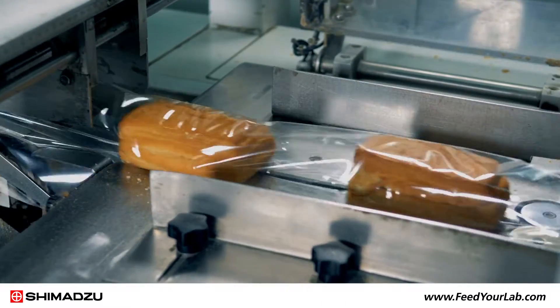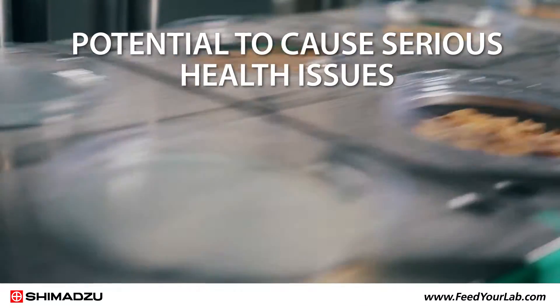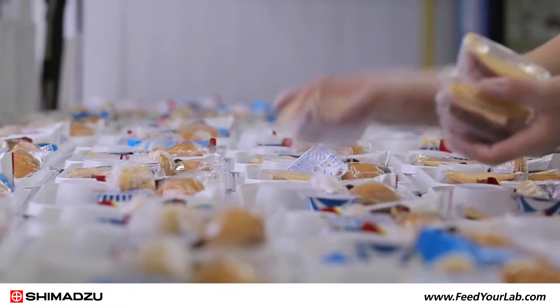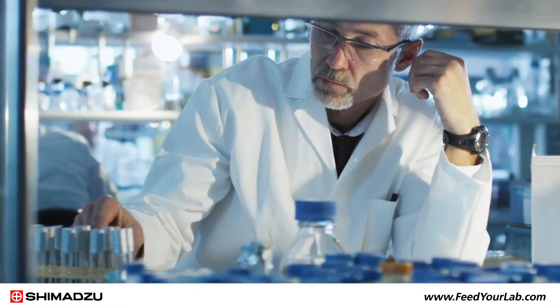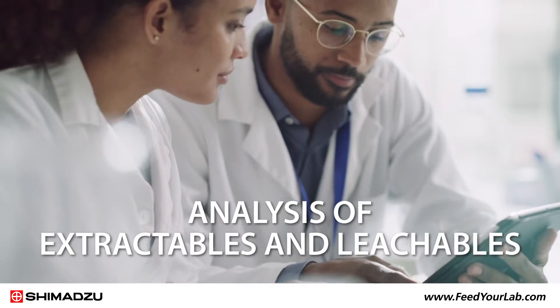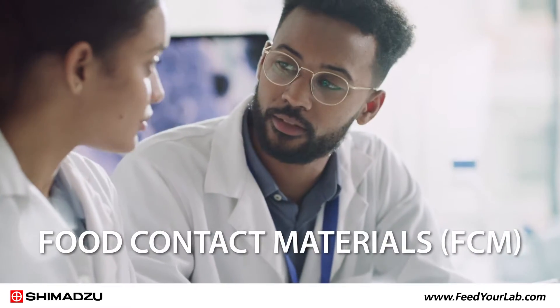Leachables and extractables raise a number of safety concerns due to their potential to cause serious health issues. To ensure consumer safety and regulatory compliance, testing facilities need to conduct fast, accurate analysis of extractables and leachables in food contact materials.